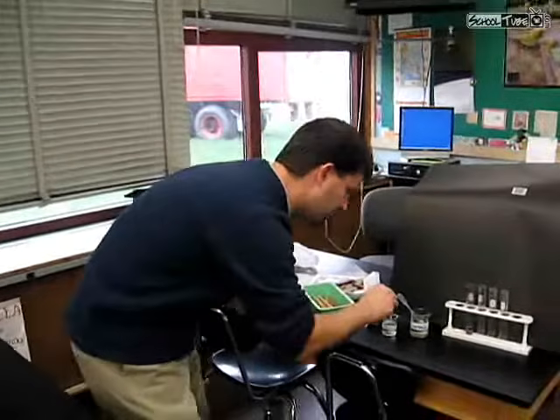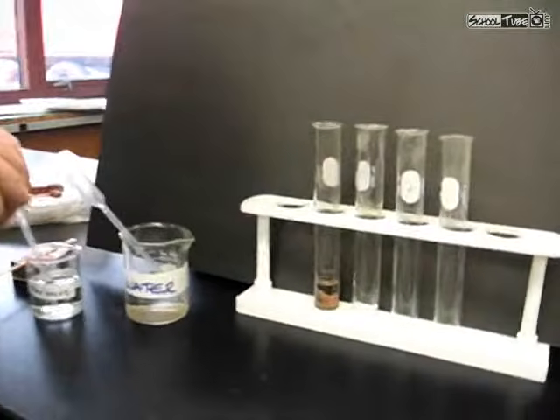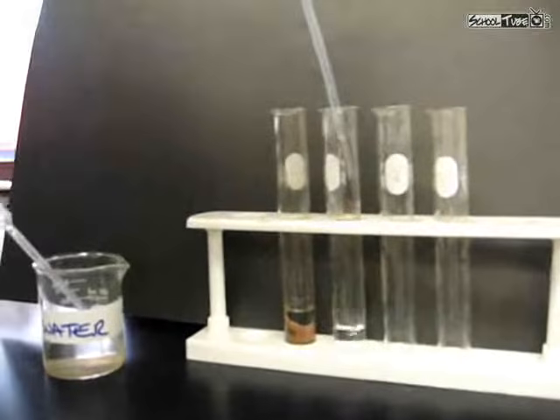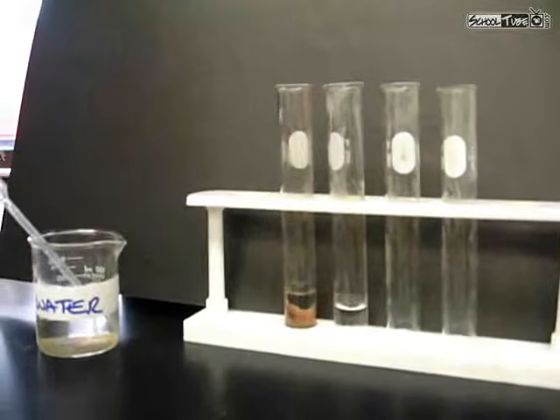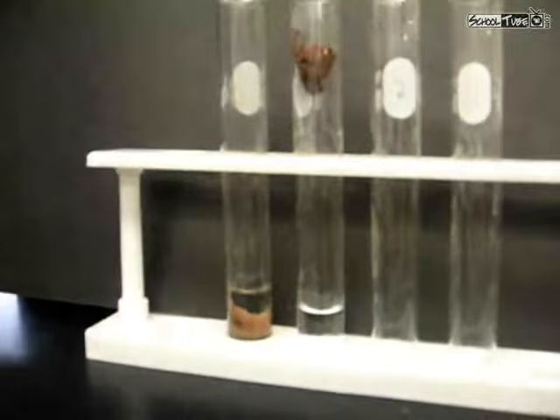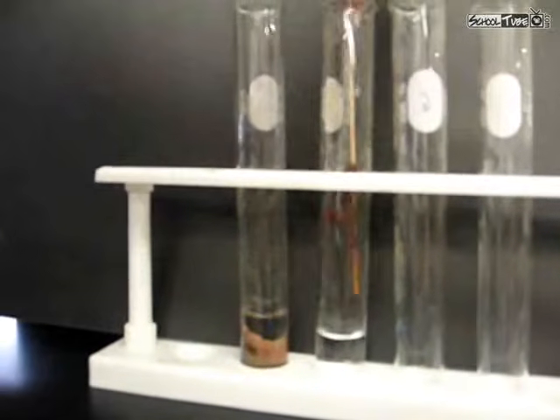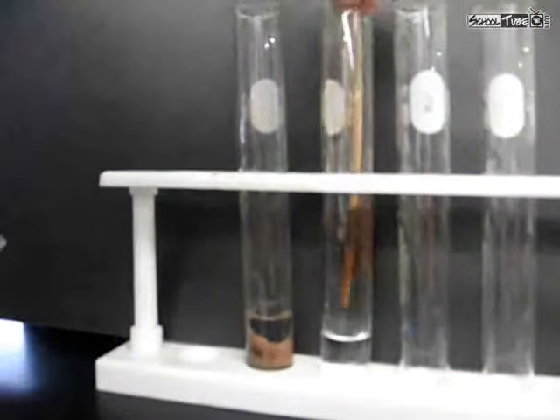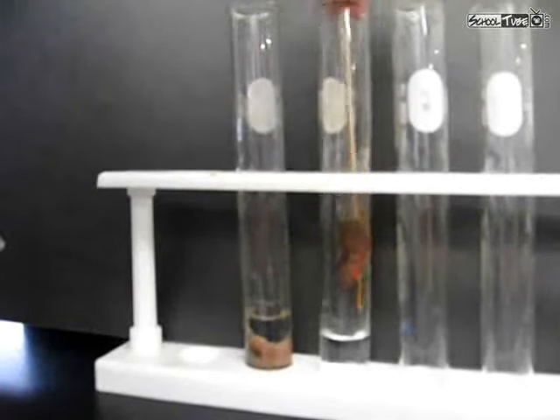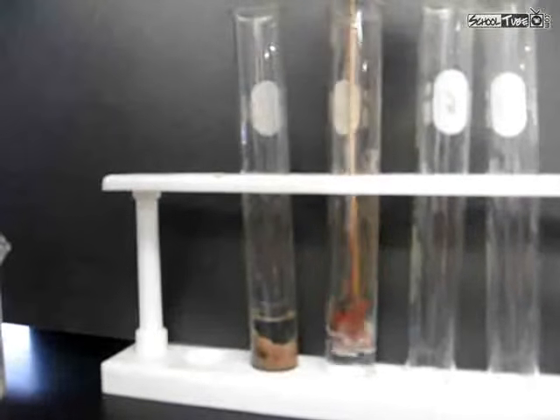All right, now we're going to work on the second tube. The second tube, we're going to put peroxide in there along with the liver. So we're going to fill, just like we did with the first one, we're going to fill this one up to the 2 centimeter mark, but this time it's going to be with the peroxide. Remember, peroxide is going to be our substrate. And we're going to add a piece of liver to that tube, and we'll push it down. It gets down in there. Uncooperative piece of liver. There it goes.